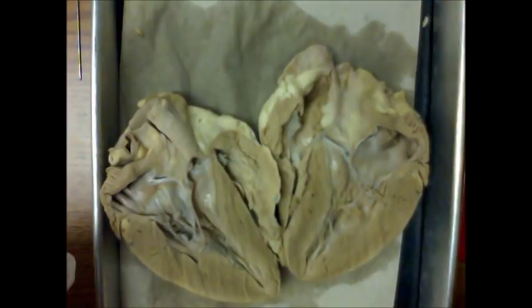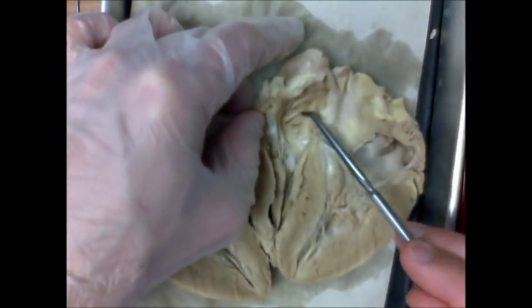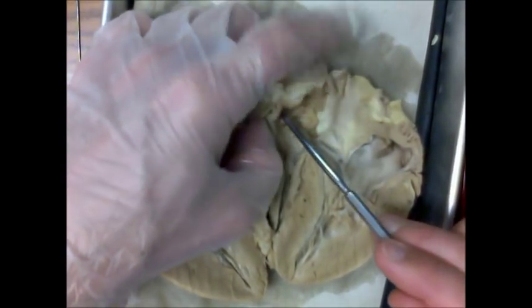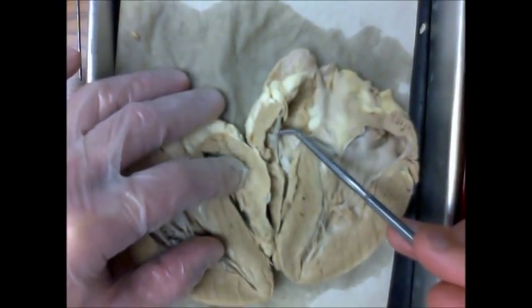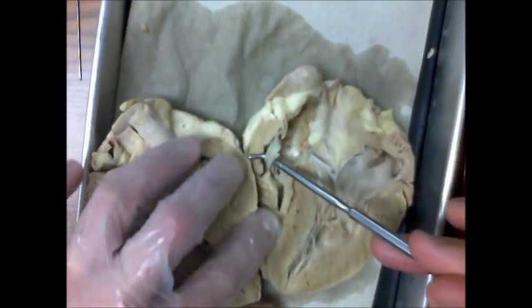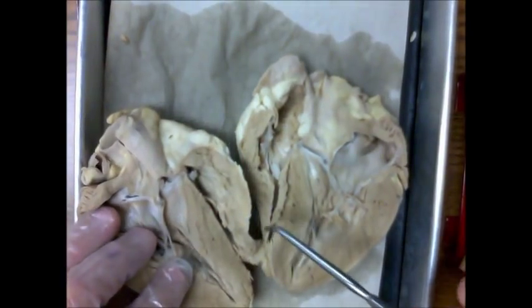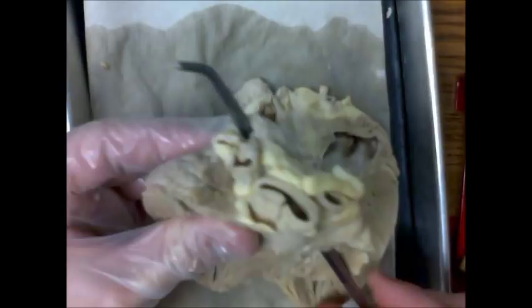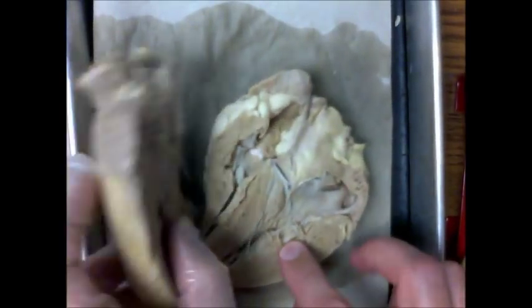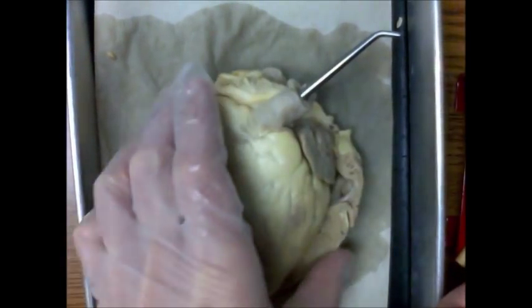Starting with the right atrium in the circulatory pathway: blood flows into the right atrium by means of the vena cava. It will then pass the atrioventricular tricuspid valve — here we can see heart strings attached to that valve. Blood then flows down into the right ventricle. From the right ventricle, blood will move up and out the pulmonary artery, which is one of the most anterior blood vessels on the surface of the heart.